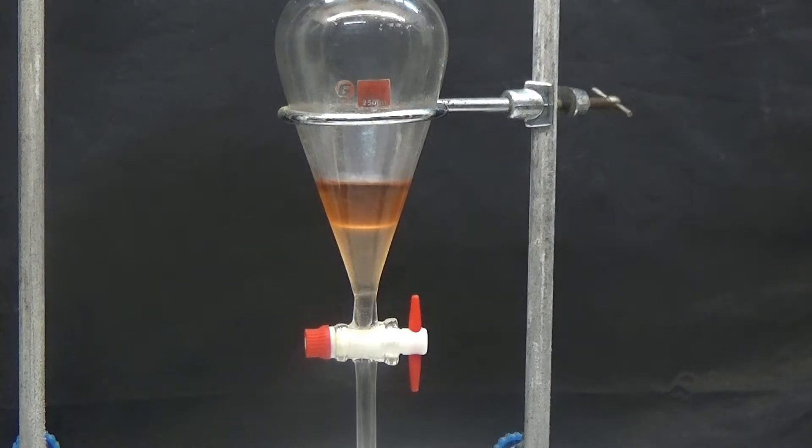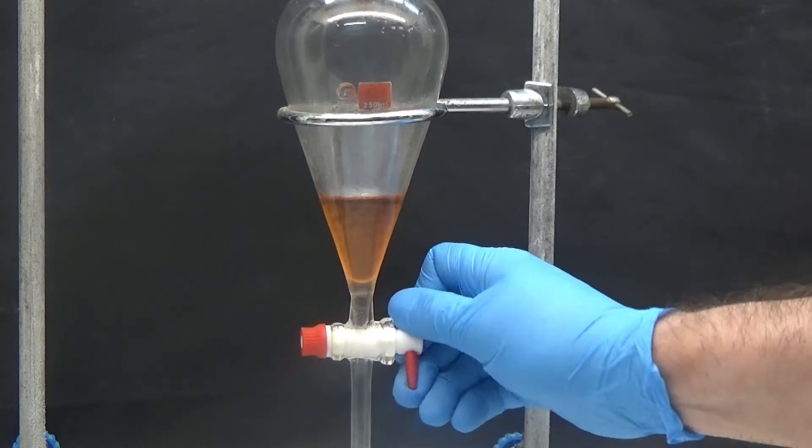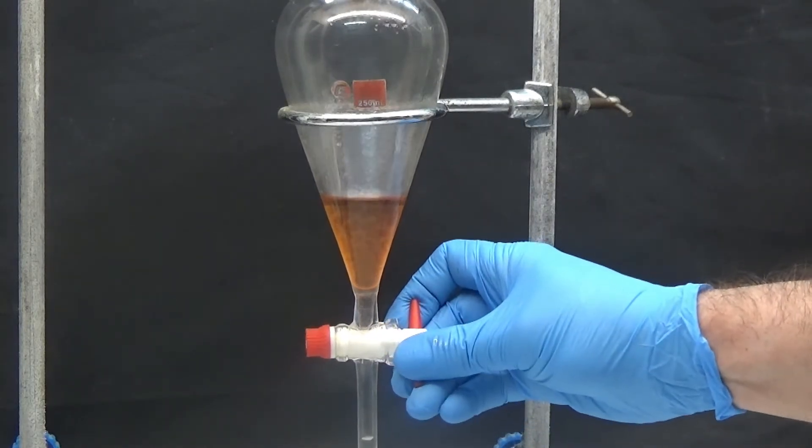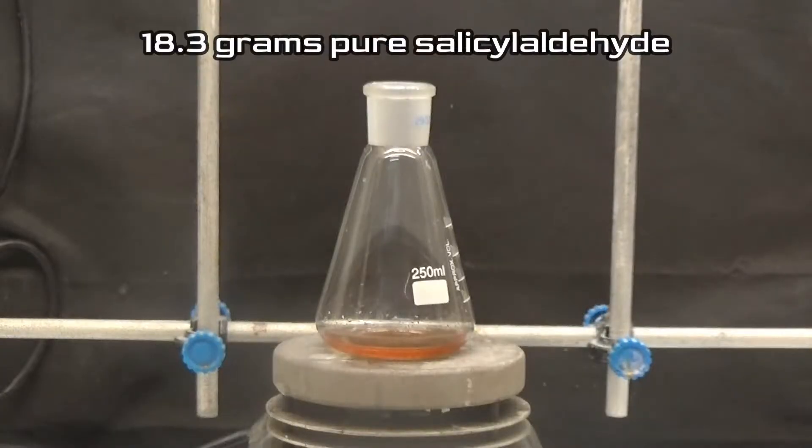After 12 hours, decant the floating oil and weigh into a 250 milliliters Erlenmeyer flask. The result is 18.3 grams.